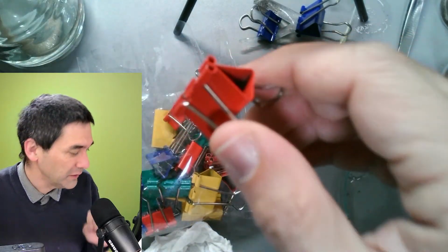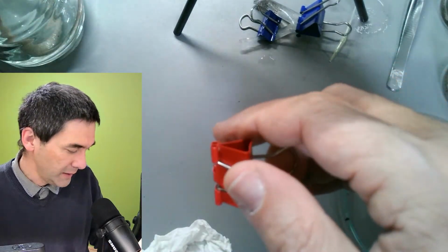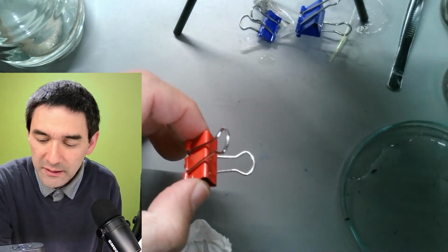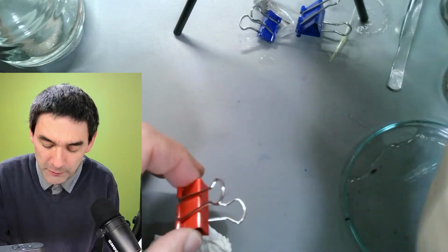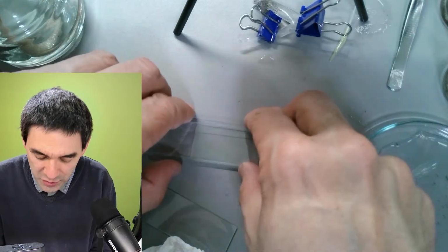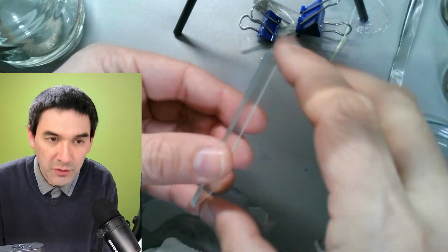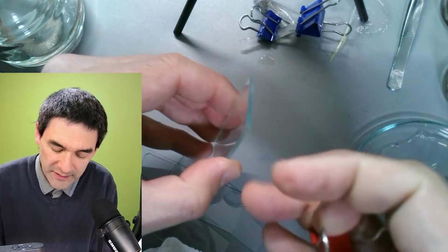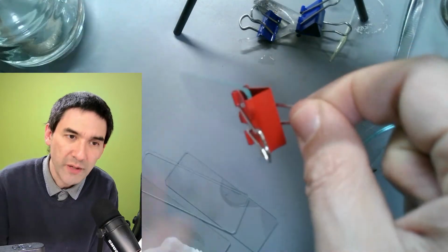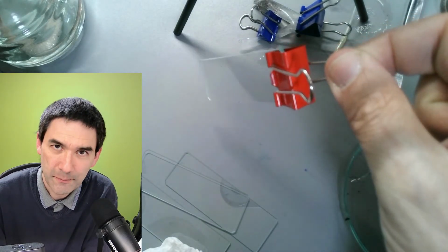Actually, I will tell you why I bought those. Okay, I will show you why. I'm going to quickly do the following. This is a little bit off topic of the Baermann funnel, but it is microscopy related nevertheless. I wanted to clamp two slides together like this. You clamp them together like this. You put a string on here and you hang it into a pond for a couple of weeks.